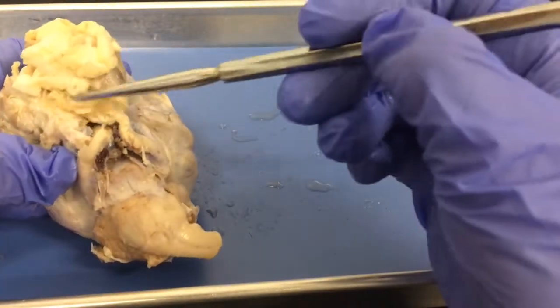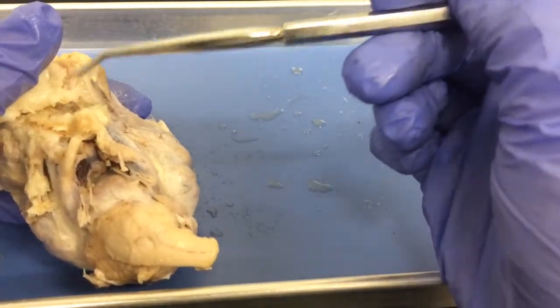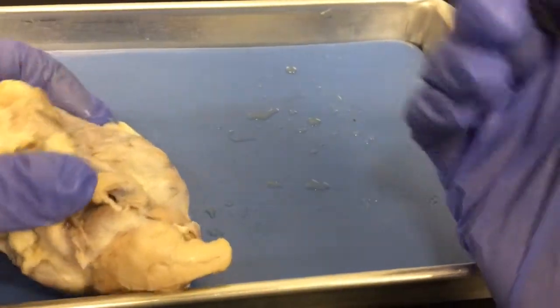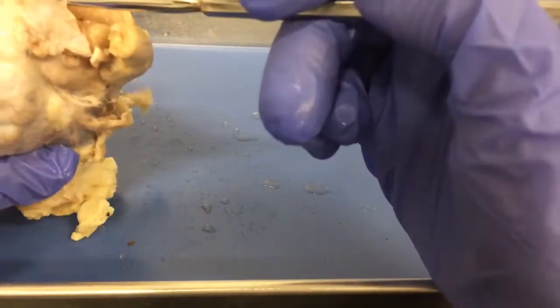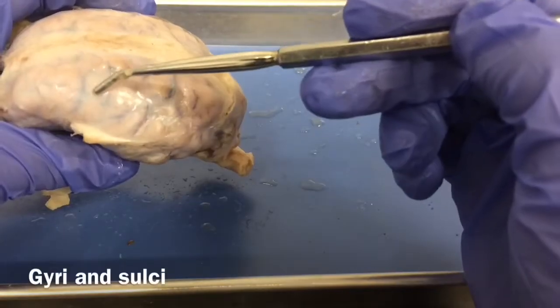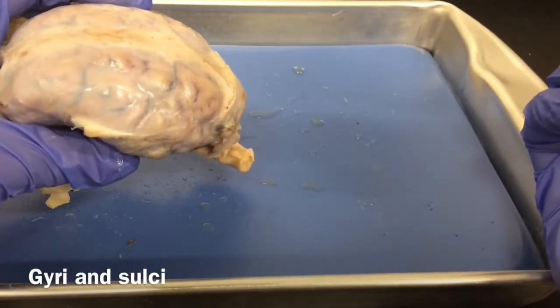Now, it's a little hard to see on this brain, but it's where we have two optic nerves that are going to be crossing each other. And so that's visible before we remove our dura mater. Now, if we flip it over, we can see our cerebellum, which is back here. Of course, this dura mater is already a little bit removed, so that'll be in this location here. Okay. We can also start to see some of our gyri and sulci. Gyri are the bumps, and the sulci are the grooves, and these make the classic squiggly pattern of the brain that we normally notice.